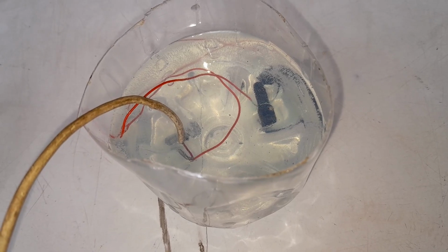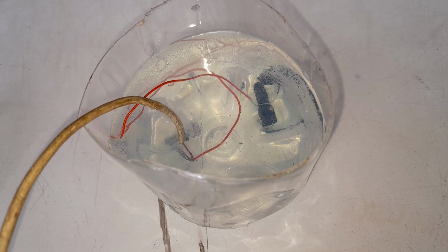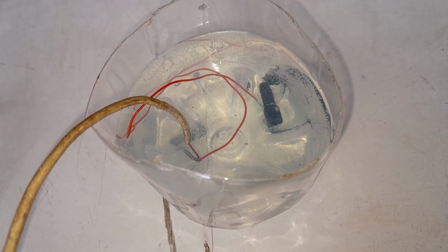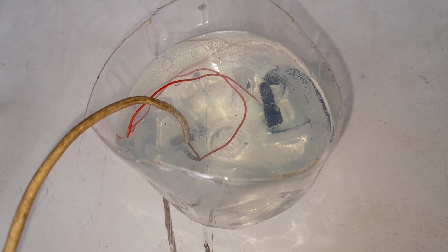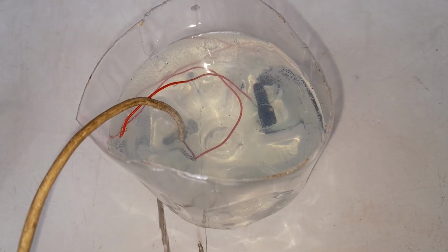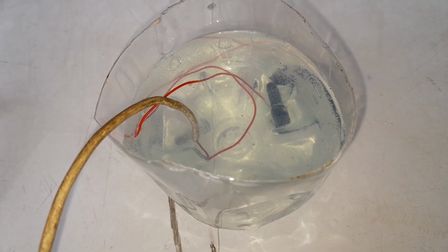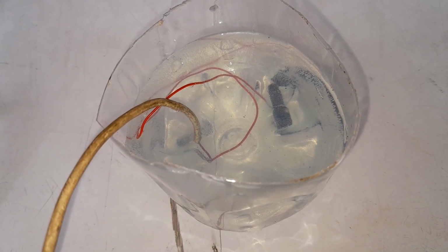As you can see here, there is a bubble of gas on the left side. That is the cathode, or the negative terminal. Hydrogen is released, as you can see right here. So many bubbles. On the right side is a piece of graphite I found. It doesn't produce that much gas, due to the current. The current I'm using right now is from a charger cable. But you can see a few little bubbles. Yeah, those are oxygen. Hydrogen is produced.